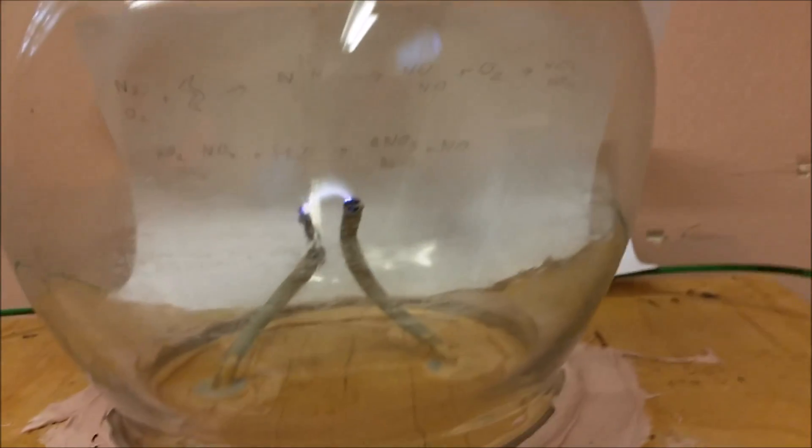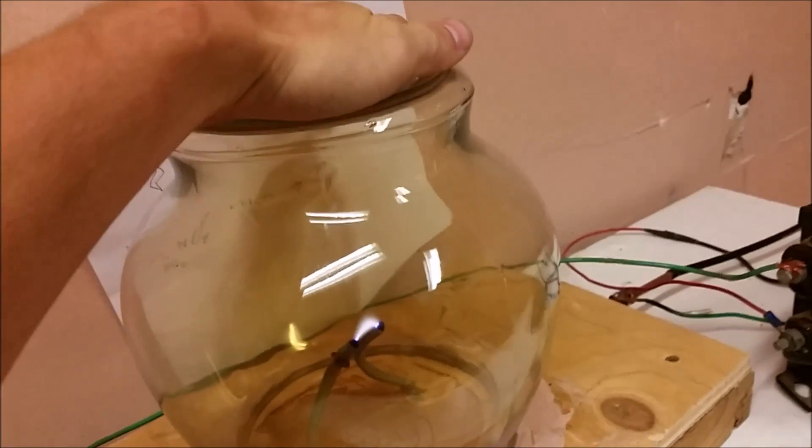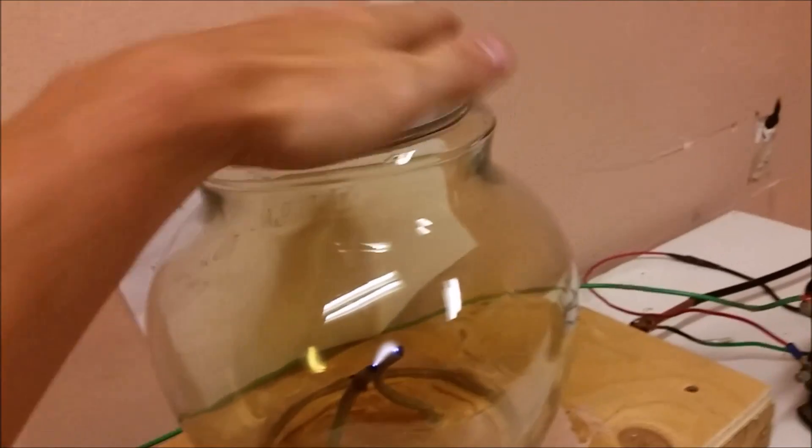You can see the sun coming in from the window right there. When I come back, that will probably not be there. The sun has gone down. It's been about five hours since I started this thing up. You can see the chamber is pretty brown. Everything's still running. In fact, if I were to turn that air pump off, this probably might be browner. I've been checking on it occasionally making sure it didn't catch on fire or anything — it's quite warm but it's not too bad. I've got a smoke detector up there just in case. Still bubbling. I'll just turn this thing off.